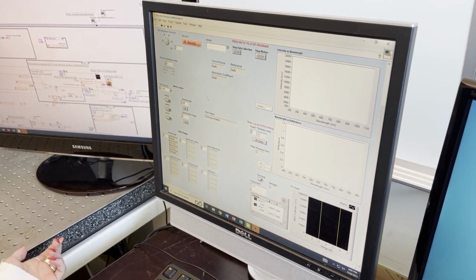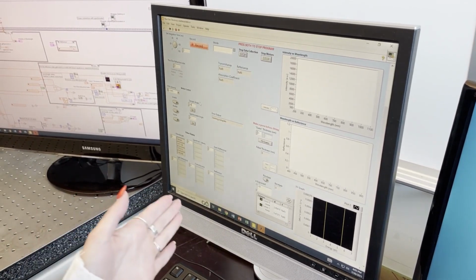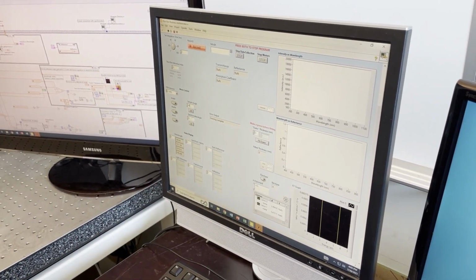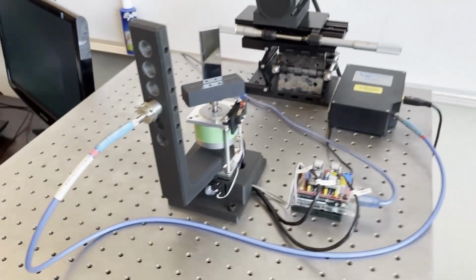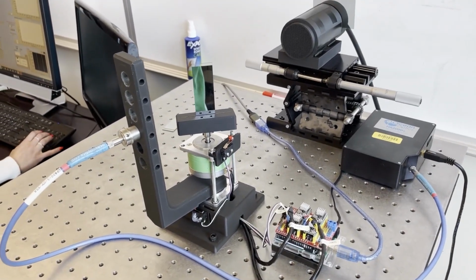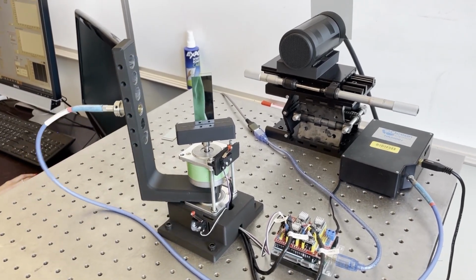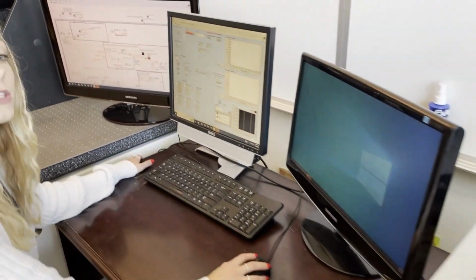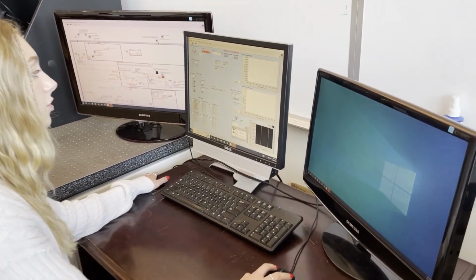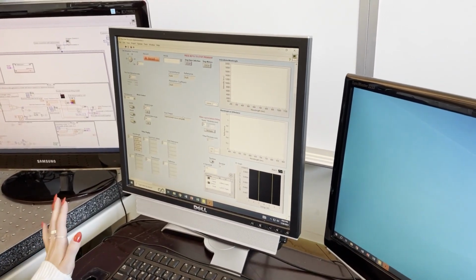Now you can send them to whatever angle you want. They're done with normalization to the incident light being 0 degrees. So you type in your angle and you hit OK, and it moves. And you can do the same thing for the other motor as well. Make sure that if you turn off the program, you re-enable and home them, because when you turn it off, it disables them and they move a little bit, so positions aren't guaranteed.